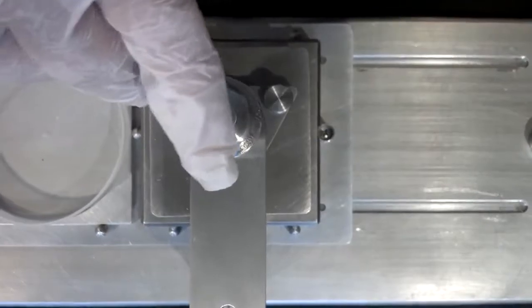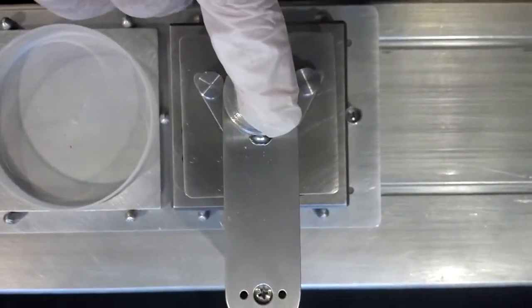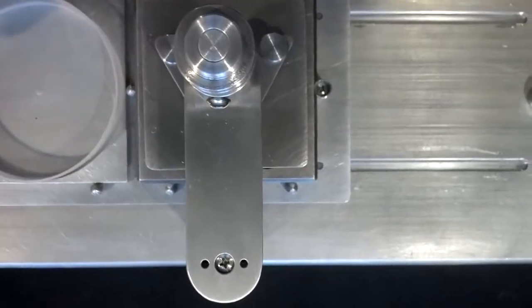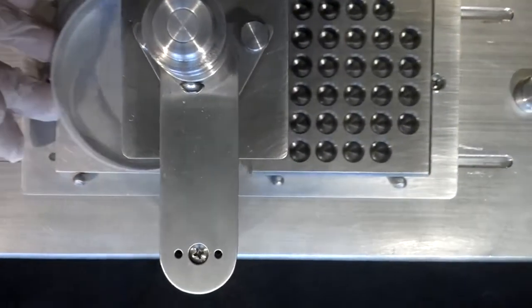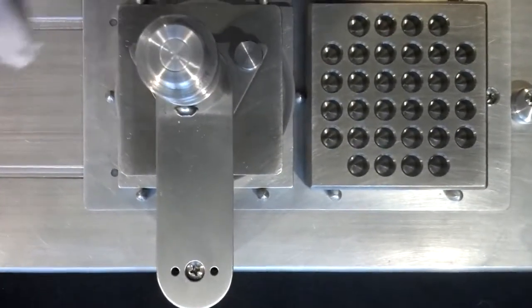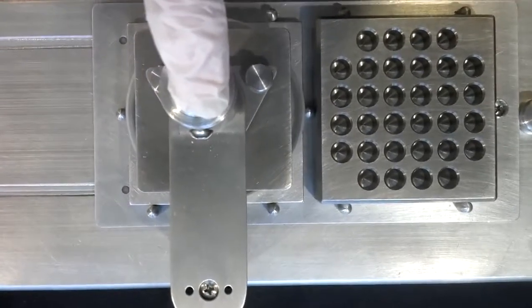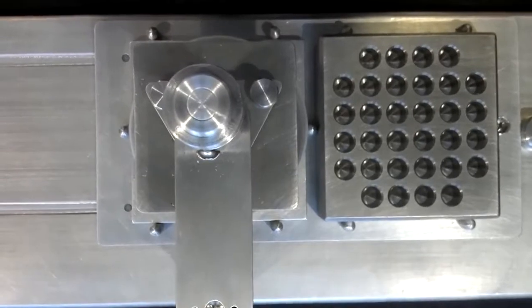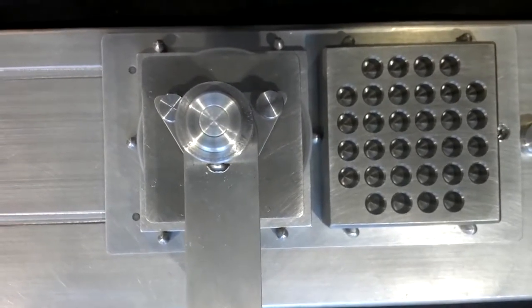You gently touch the plunger down into the inocula. You then move your petri dish over on the slide, and then you score the agar or whatever medium that you are using. And that is it.